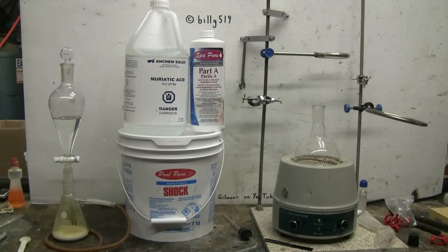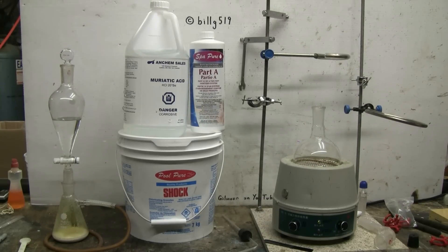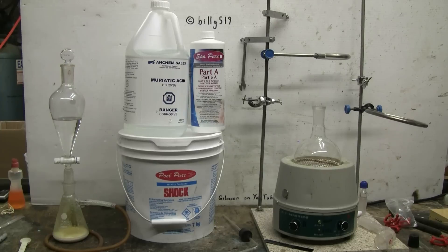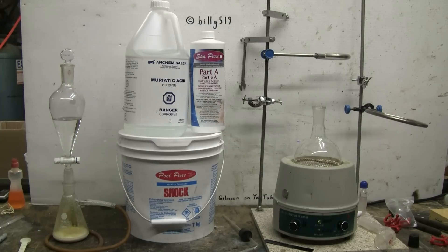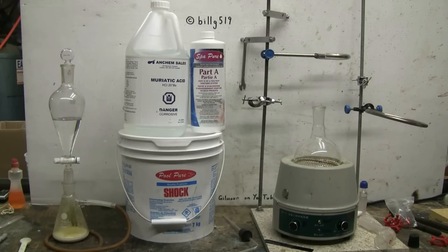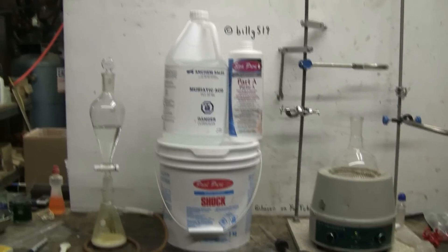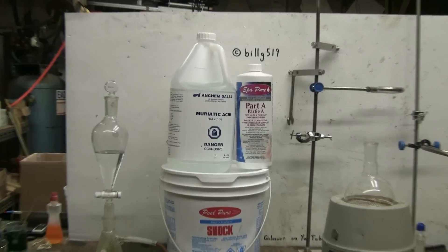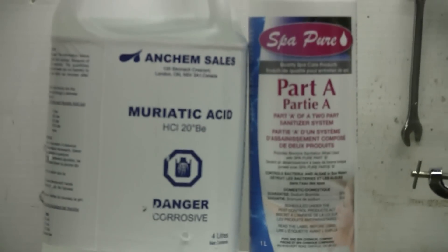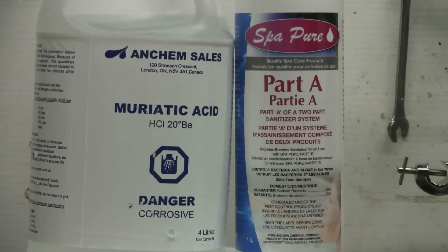Today we're going to make a small quantity of elemental bromine. In order to do so we need three chemicals. First thing we'll need is some hydrochloric acid which is readily available as muriatic acid at pool stores.